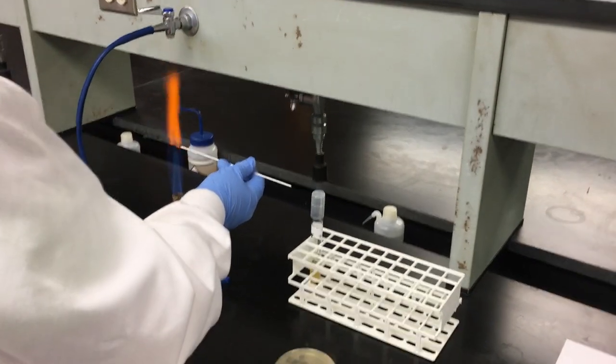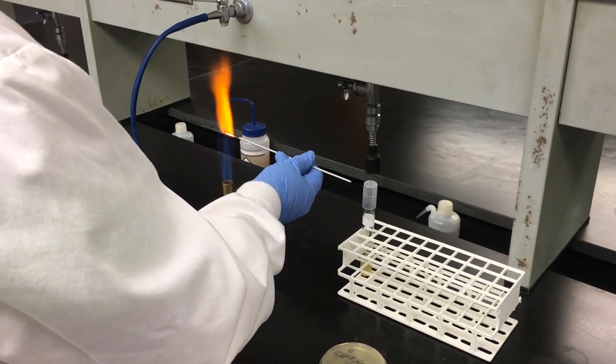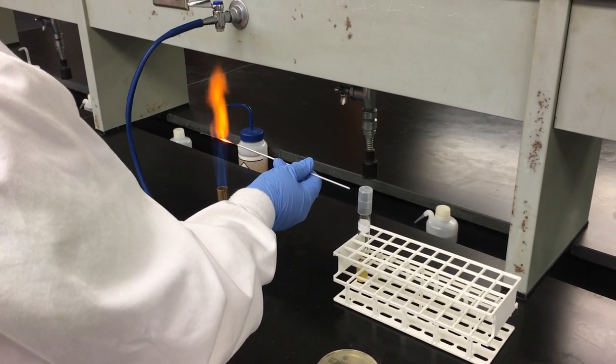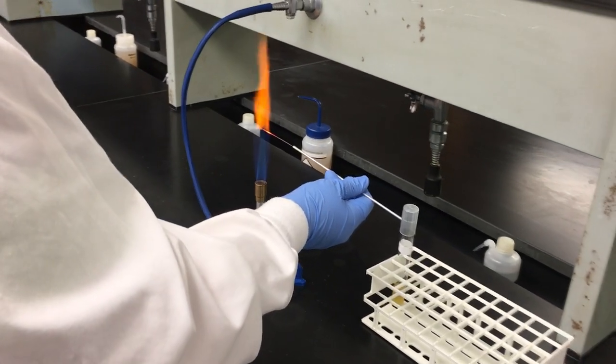I will then re-sterilize my needle. Handle to tip again. Your first quadrant should look like the plate that is now on display.